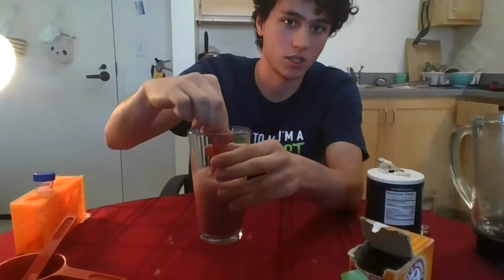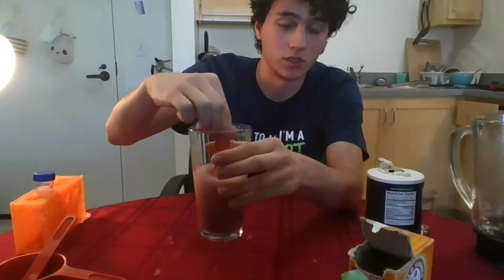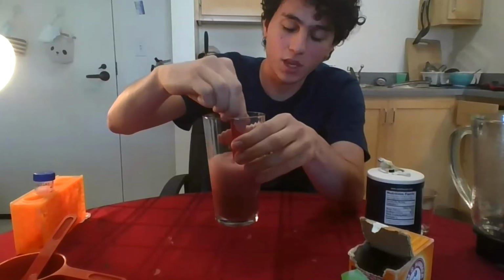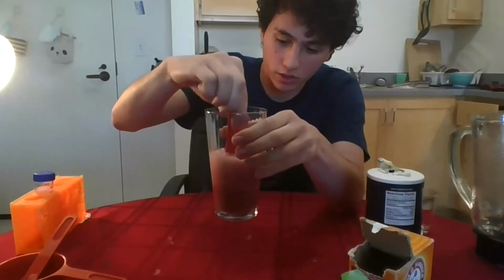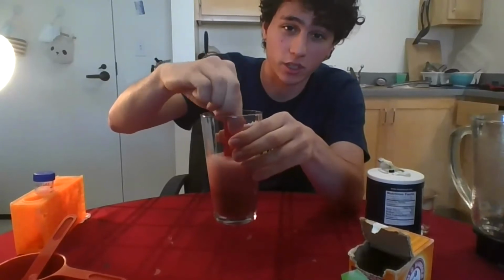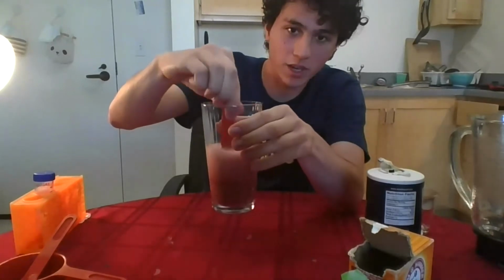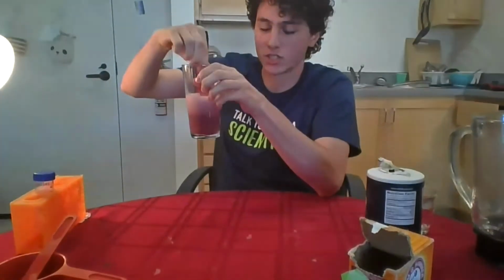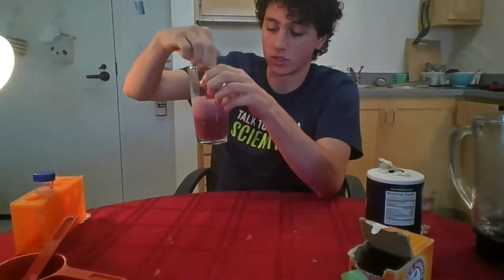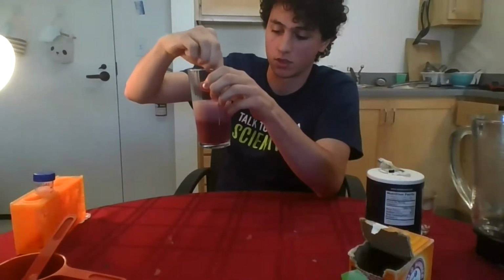And so the DNA is not being attacked by or read by these little proteins. And so the bubbling is going to continue for a couple of minutes. What you want to do is continue stirring all the way until some of the bubbling begins to end. And you can see that the liquid is going to turn darker. Before it was a very light kind of reddish color, but as you can see right now, it's starting to become much darker. The bubbling is going to continue at the top, but it's going to stop towards the bottom of the glass. So we're just going to continue like that.